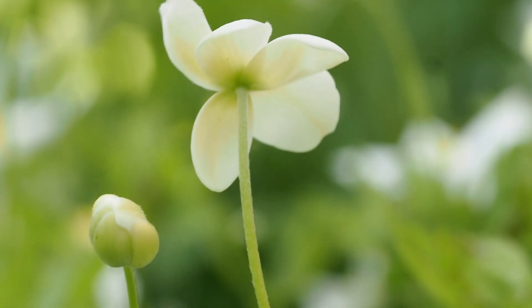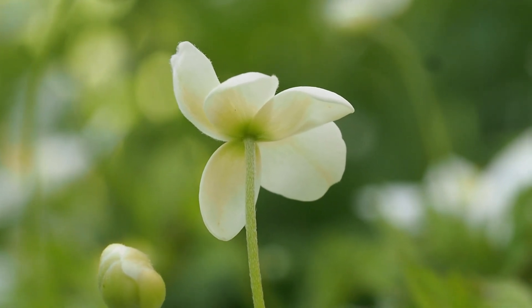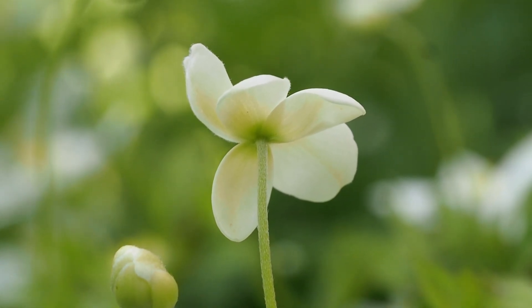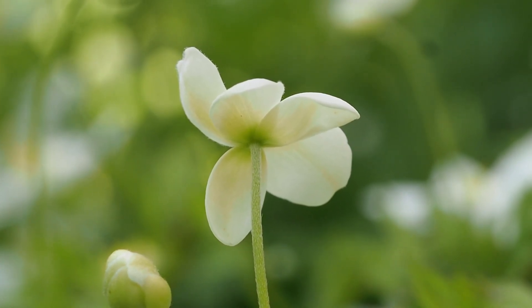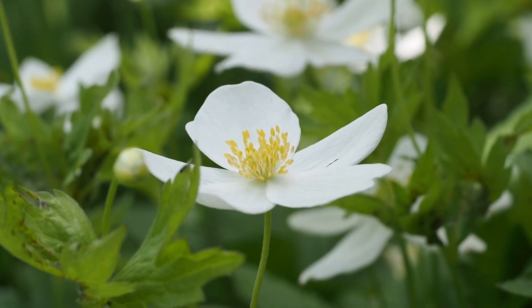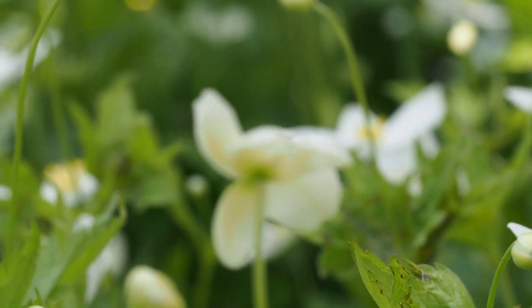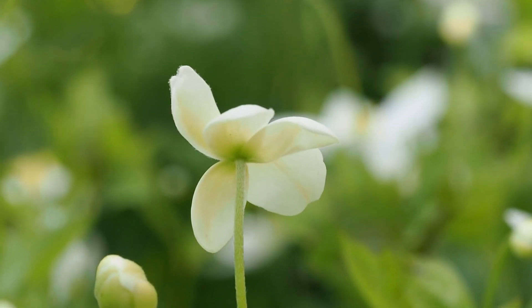As far as what those colorful attractive parts are, if we look at the flower when it's just beginning to open up, we'll see that there's nothing underneath there. This is a very young flower, and these things that are opening up — these colorful parts we'd be tempted to call petals — it turns out they're sepals. This flower doesn't actually have any petals; it just has sepals.